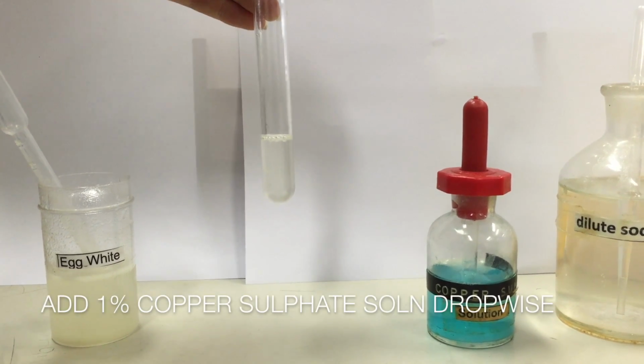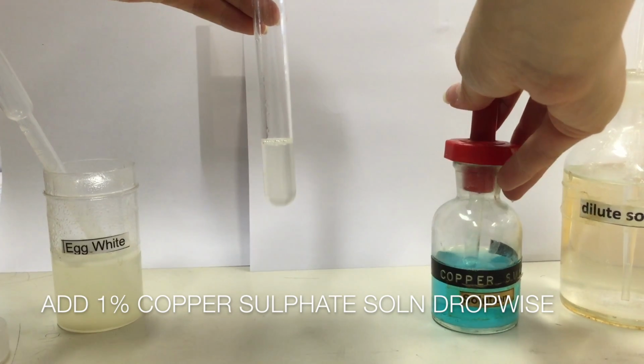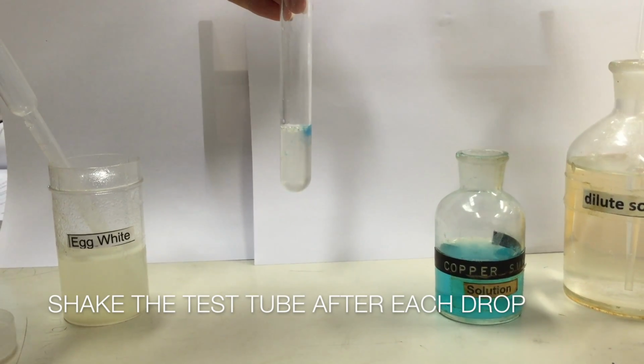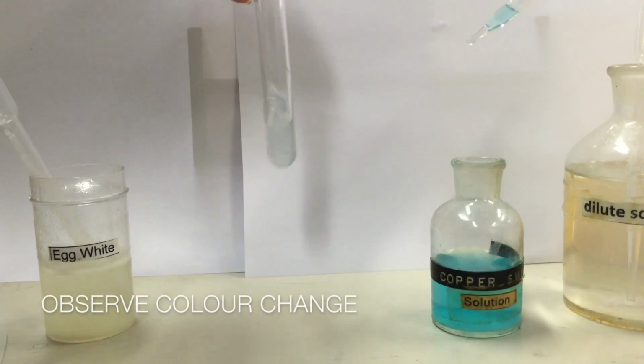We will add 1% copper sulfate solution, drop by drop, into the test tube. Remember to shake the test tube after each drop. We will observe the color change.